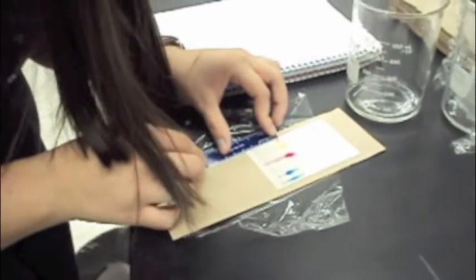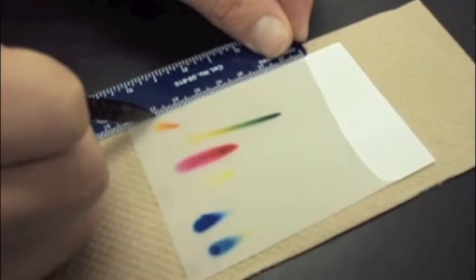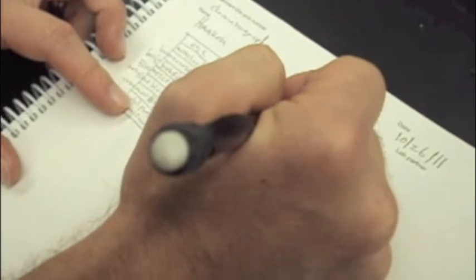Common choices include water, acetic acid, 2-propanol, and reasonable combinations of these. Place a small quantity of your mobile phase into a beaker. Next, place the TLC plate in the beaker and allow the solvent to move up the paper until it appears to have stopped. Cover the beaker for a closed environment with saran wrap.